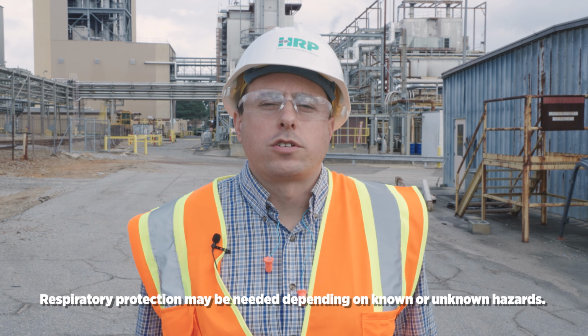So now we're going to fill out this section specifically regarding the sample, when it was collected, and the type of collection method. So here it says customer sample ID. So we need to give this sample a specific identification. This is where I've seen facilities in the past maybe getting into some trouble, because they can't associate the chain of custody with the particular sample. It's important to mark the container with a specific identification and then match that identification on the chain of custody so that it can be cross-referenced when the results are received.